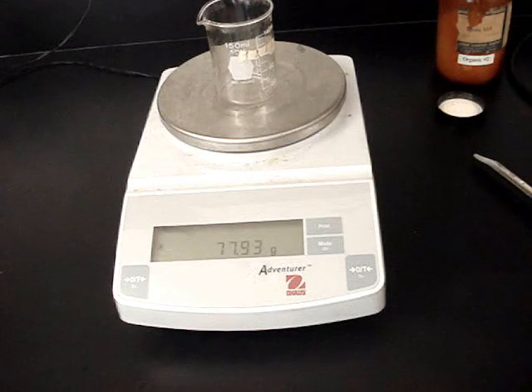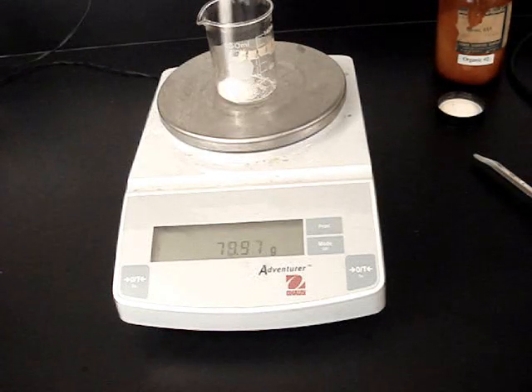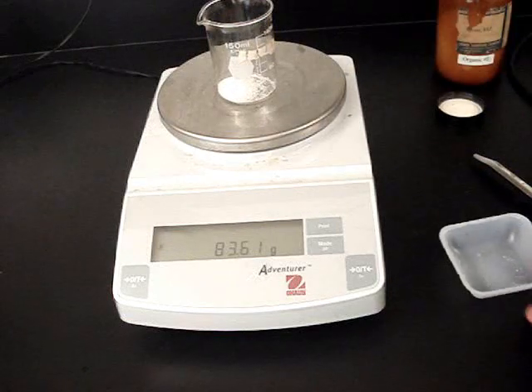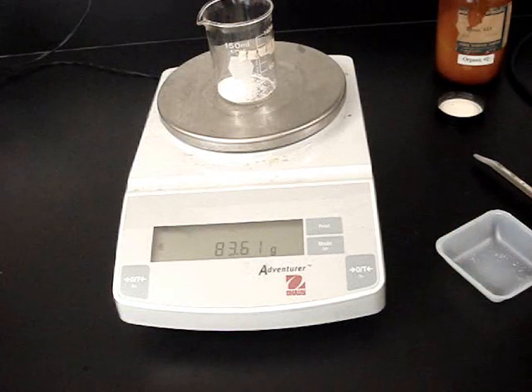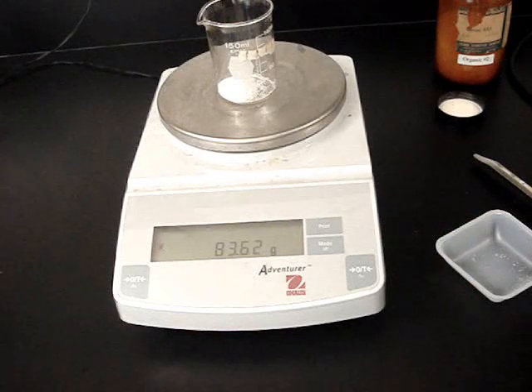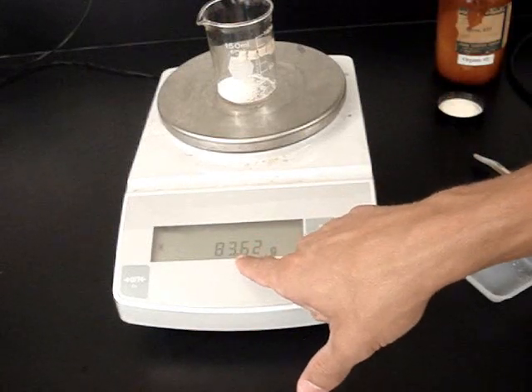If I pour the sugar in that, now since I didn't hit zero now, that will be the mass of both the beaker and the sugar. So you just have to be really careful of when you push that tare button so that you know exactly what this number you're seeing down here is measuring.